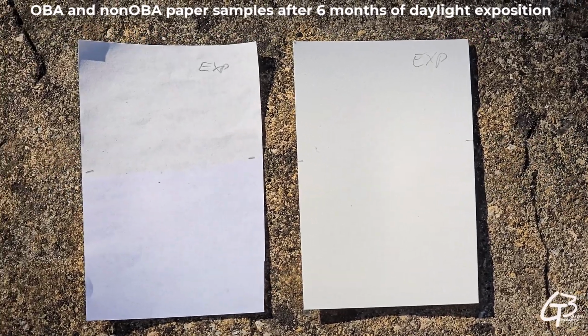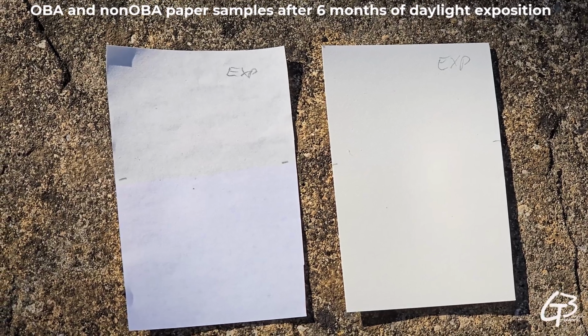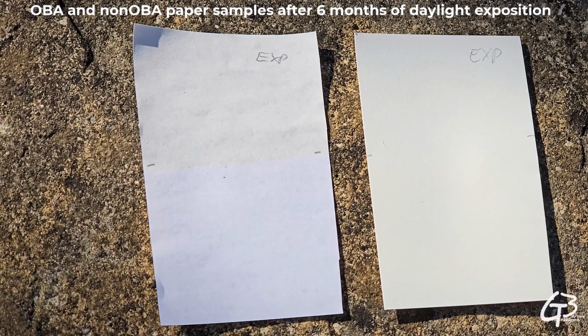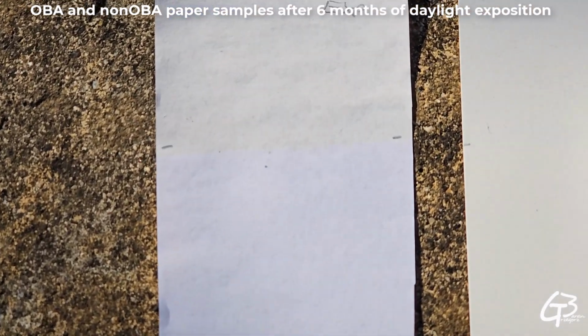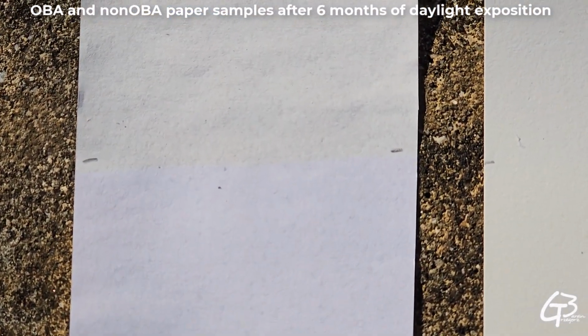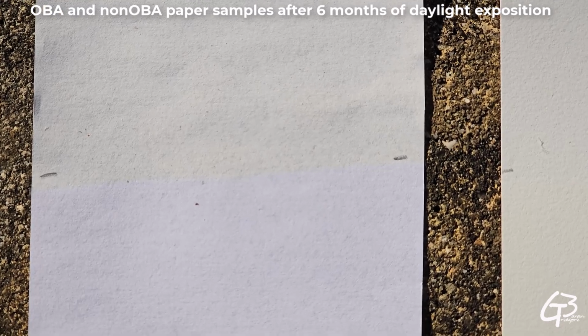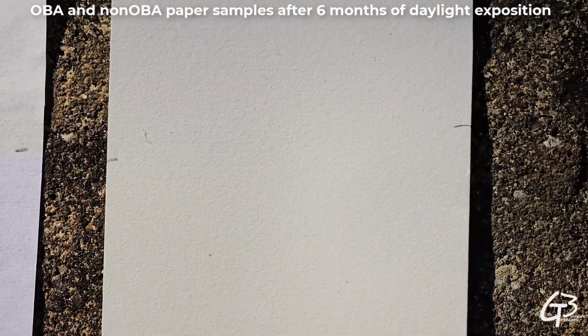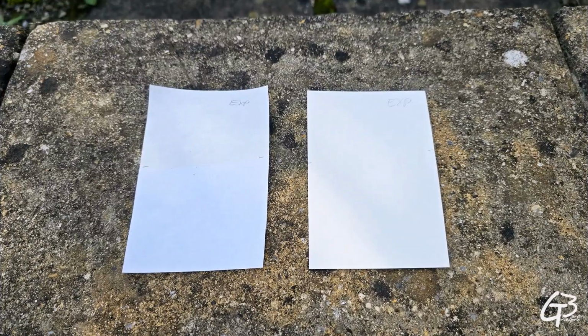Because the OBA substance was converting ultraviolet into blue, with the OBA gone, the blue component decreased. Therefore, the color balance shifted towards red, making the paper look more yellowish when seen in daylight. Let's stop eyeballing these samples and just measure them with the Spectra 2 color spectrometer in both illumination modes.